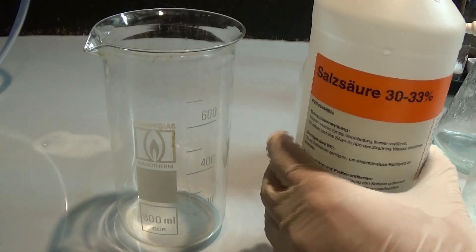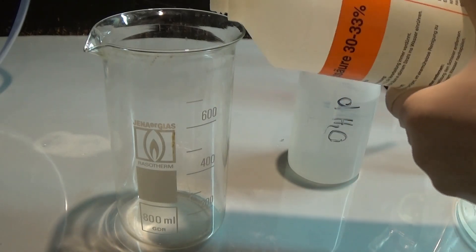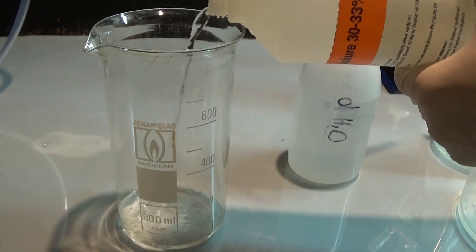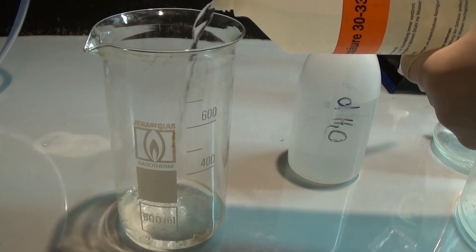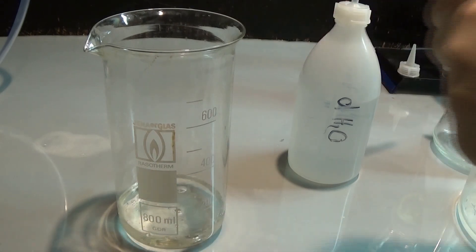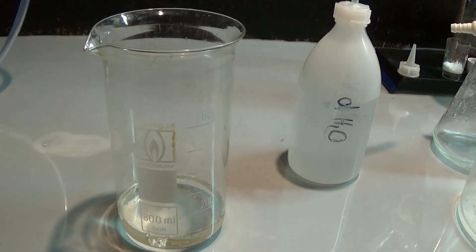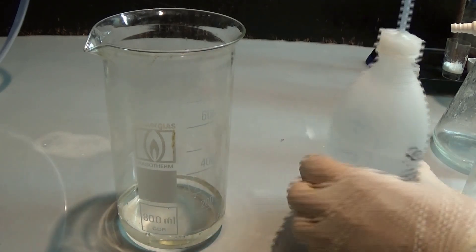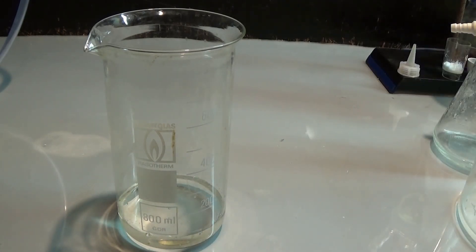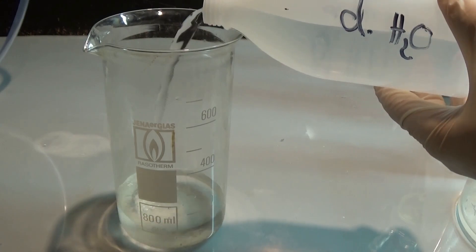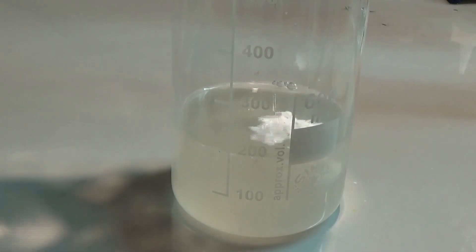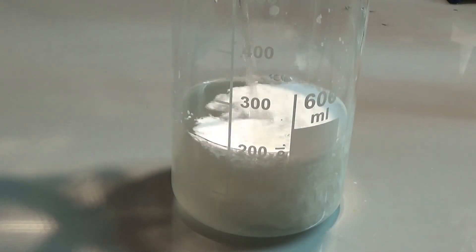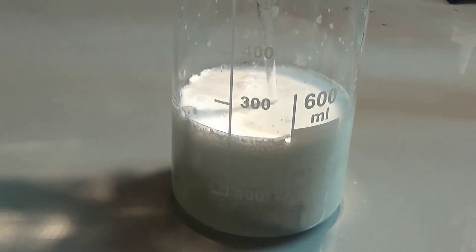And I could only save the whole thing by reacting my leftover reaction mixture with dilute hydrochloric acid, producing lead chloride. Therefore I diluted some HCl and mixed it with my reaction mixture. This will react all the carbonates, oxides, and the acetate into lead chloride, which is insoluble in water and crashes out.